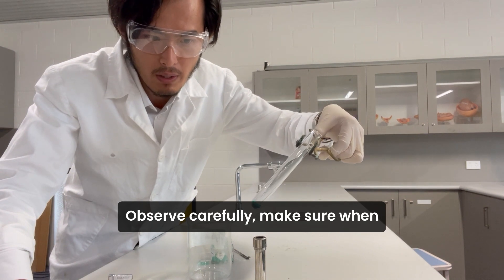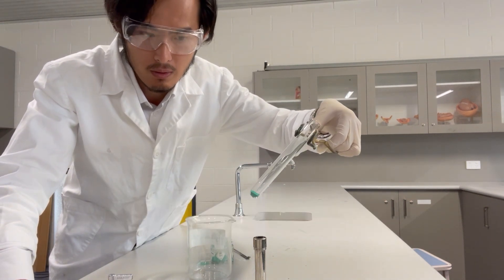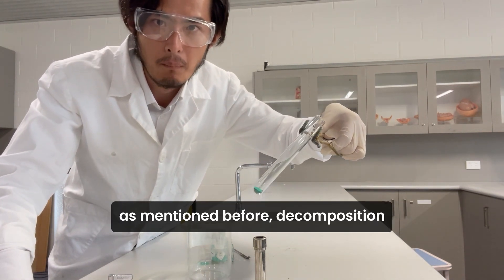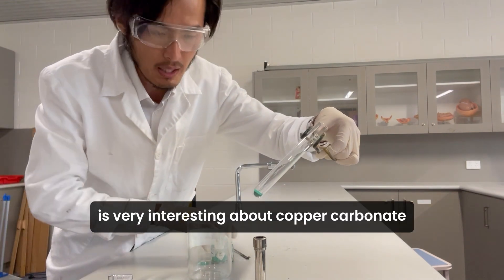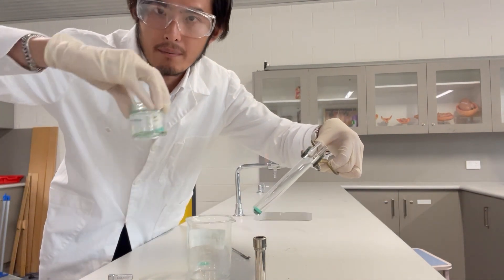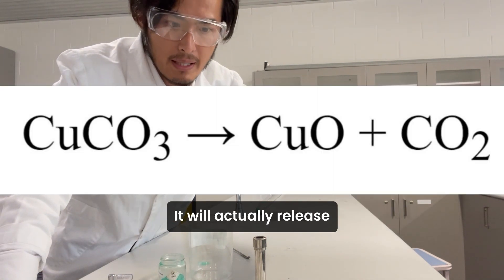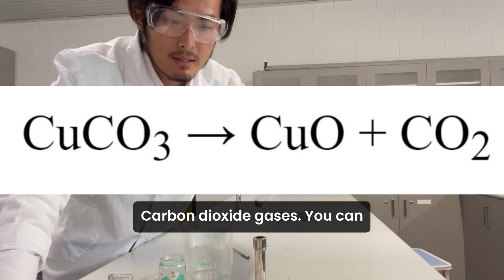Make sure when you're doing the experiment you're not pointing the tube towards yourself. As mentioned before, decomposition reaction is breaking down. Copper carbonate will break down into copper oxide and carbon dioxide gas.